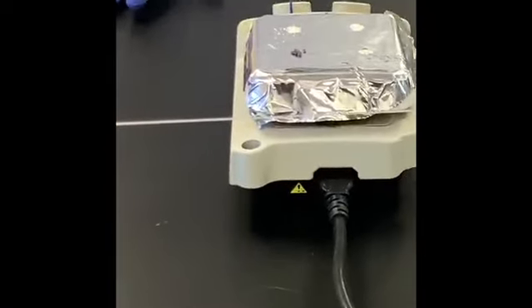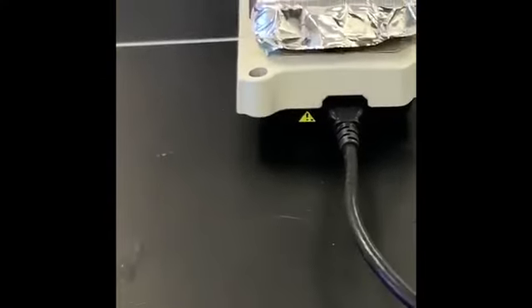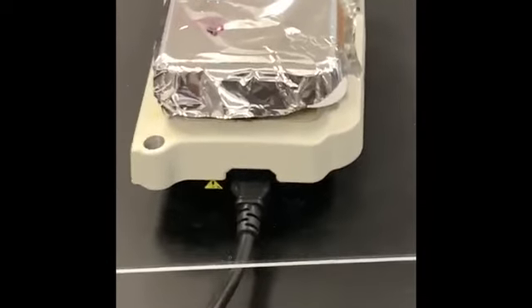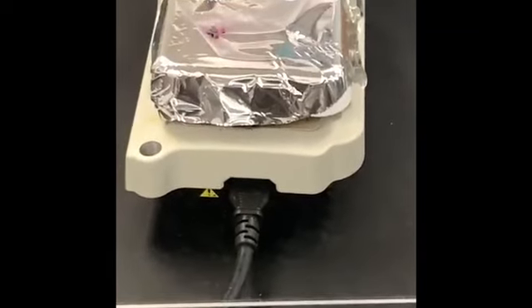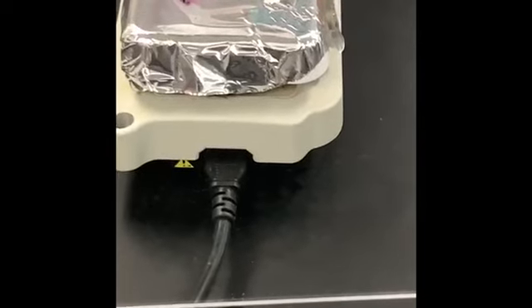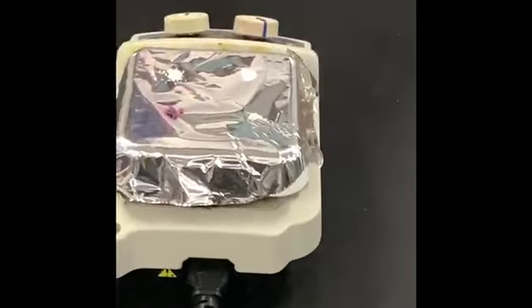So we'll have to give it some time because it will take a while for this hot plate to heat up and to get to a temperature that will begin to melt. So by now you should see something happening on at least one of the samples. And the reason I have this snorkel close to it is so that any fumes that are given out should be sucked out of the bowl.